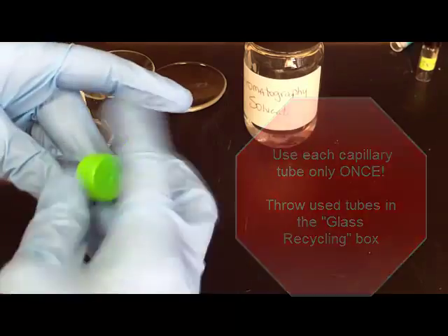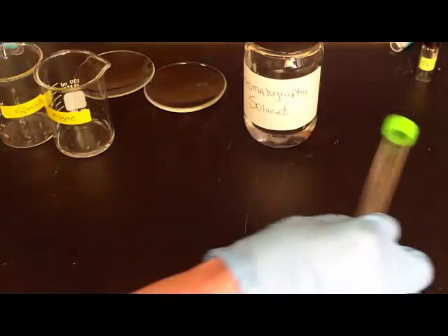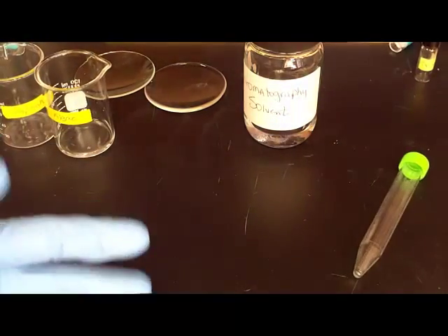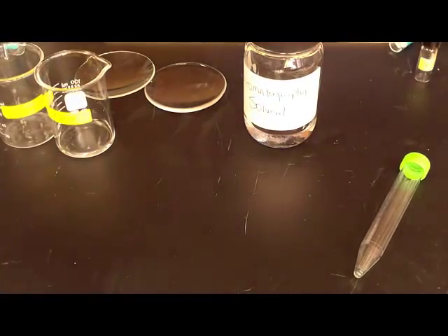We've got six in each vial. So if you have three people in your group you'll use three for practice and then one for algae and one for spinach.